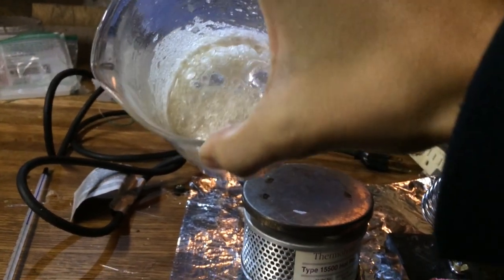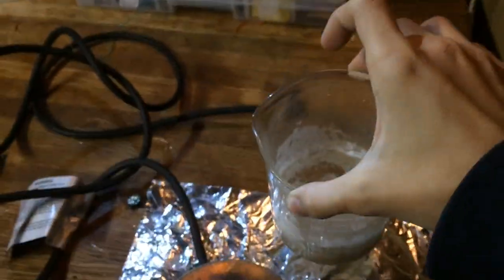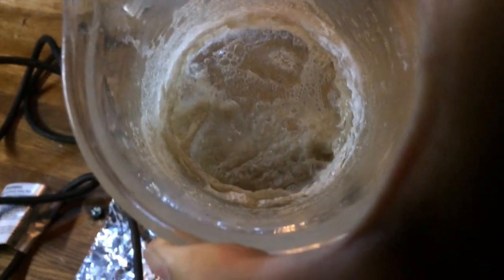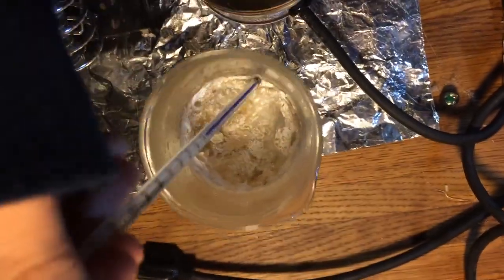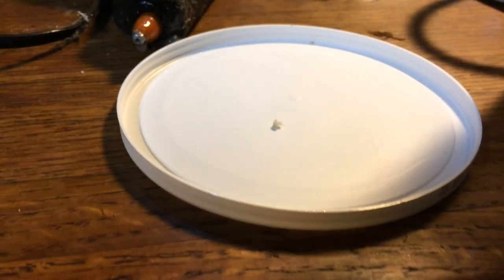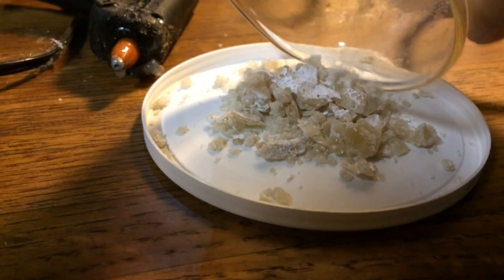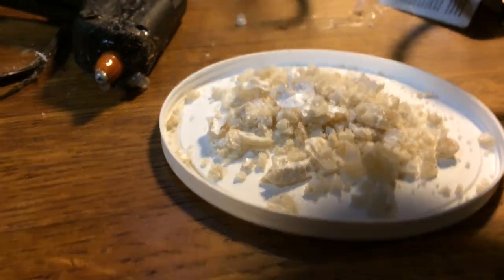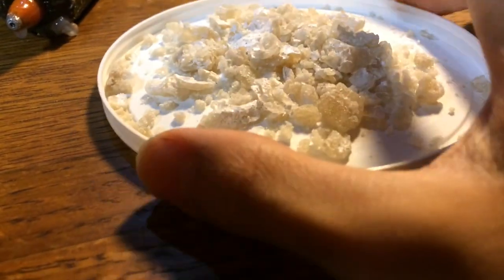This is now about done. You can see that there's a little bit of water left in here, which I can probably just pour off. Oh boy, this is hot — you should probably be wearing nitrile gloves. You can see that there's a lot of solid left there, which I can take out and dry off. Now it's time to pour all the calcium chloride and impurities onto this makeshift watch glass. I couldn't find any black lids, so this will have to do.